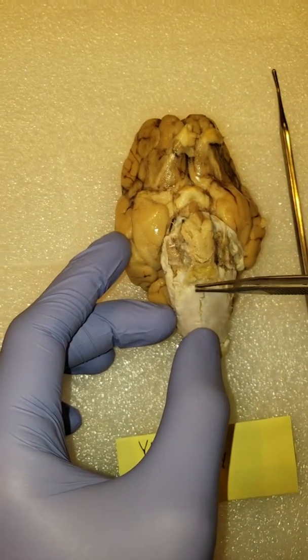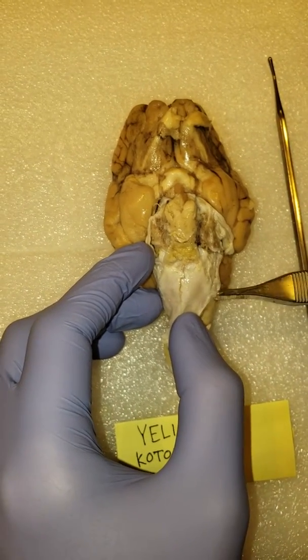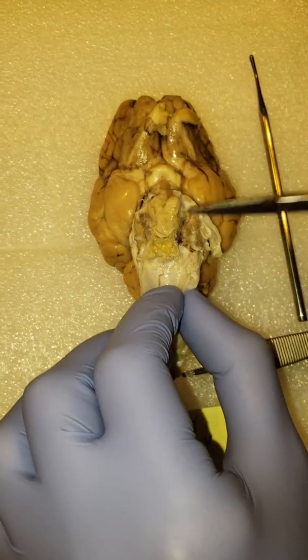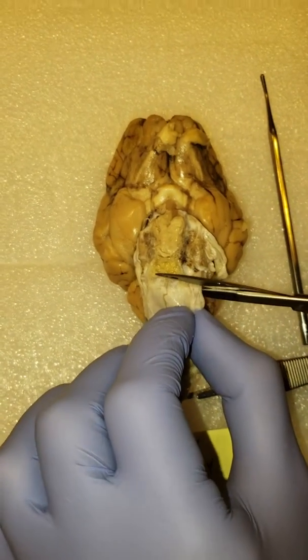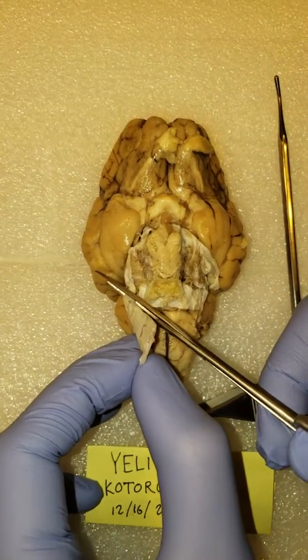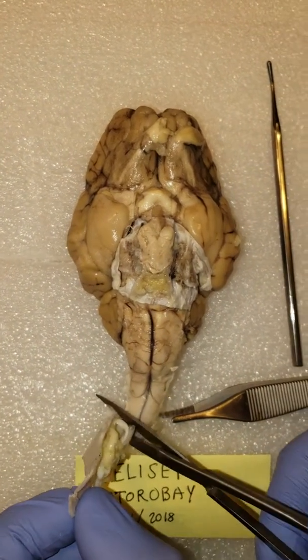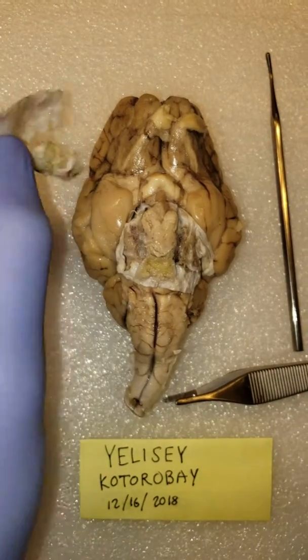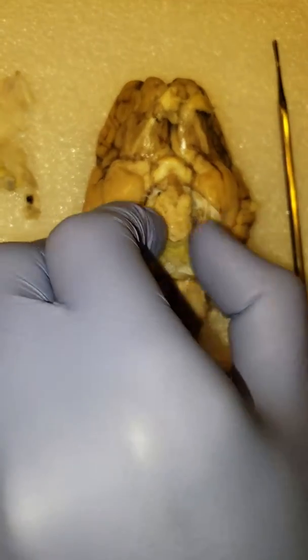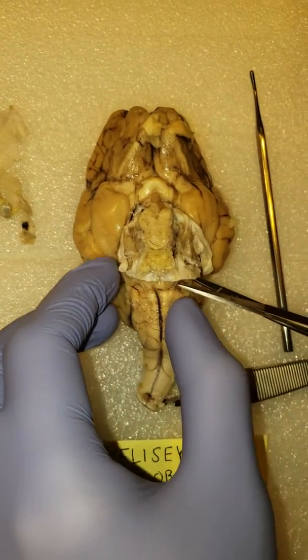and it's actually quite stuck on there. I don't even know if I can. Can I pop that off? Yay, you can. All right. Here, one second. I'm just going to go ahead and separate that, just so we can have a better look underneath. Okie dokes. That's really stiff. Oh man, it's very hard. I think that's about as much as we're going to be able to remove, really.